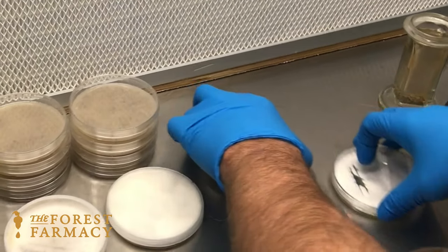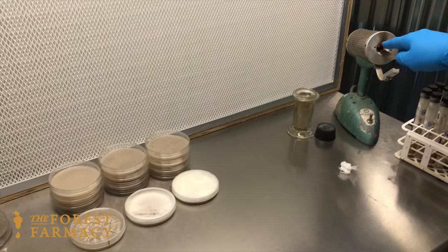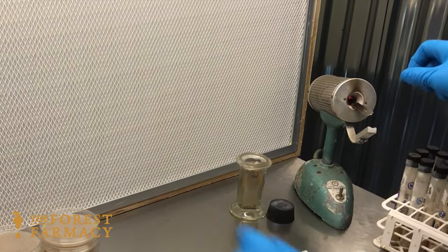I take a piece of mycelium out of that one, that goes in there, and these get pushed around to here. Then I'll do the next ones. I'm sterilizing the scalpel now, going to quench it, let it cool off, and then I'll go to the next one.